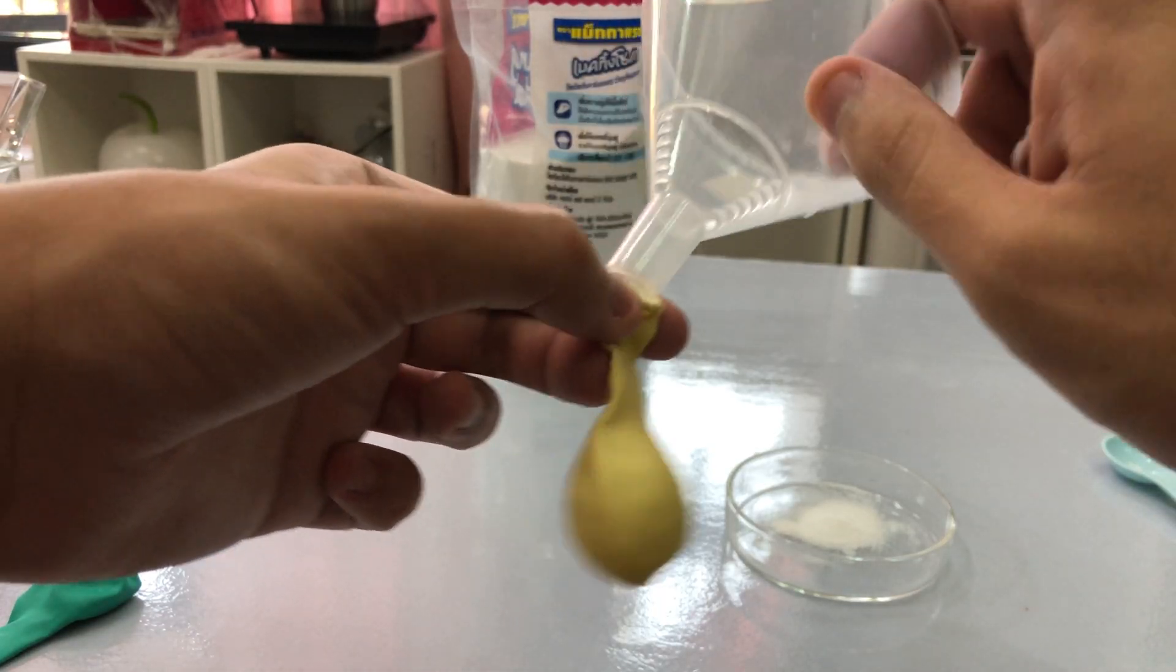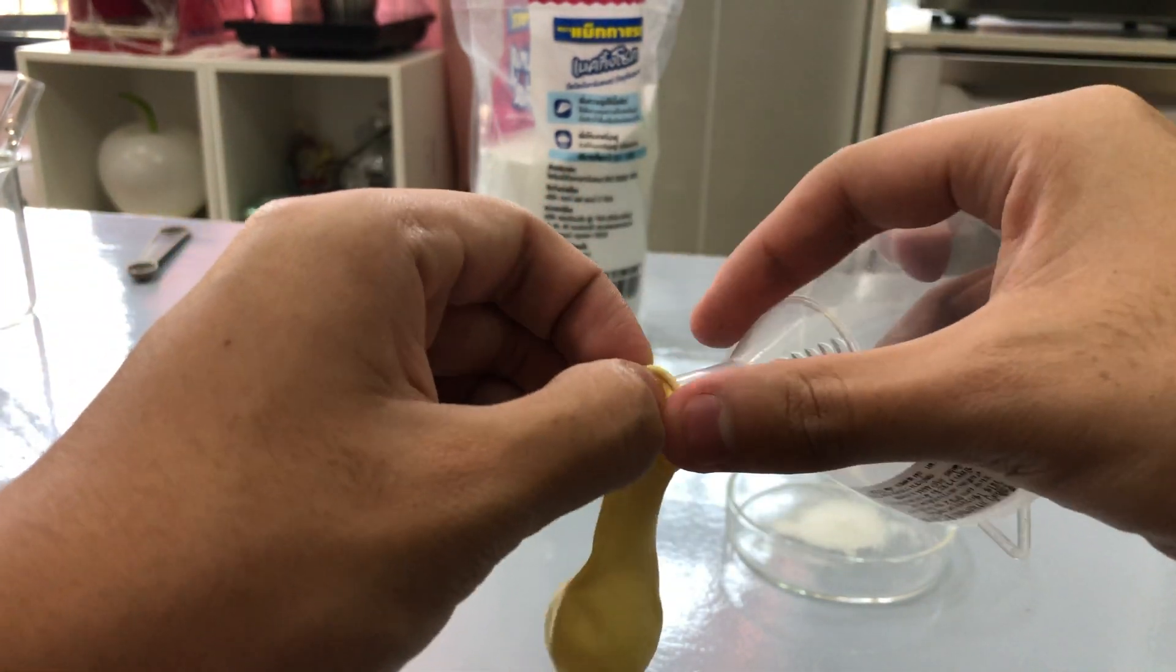Next step, we will use a funnel to put the sodium bicarbonate into the balloons.